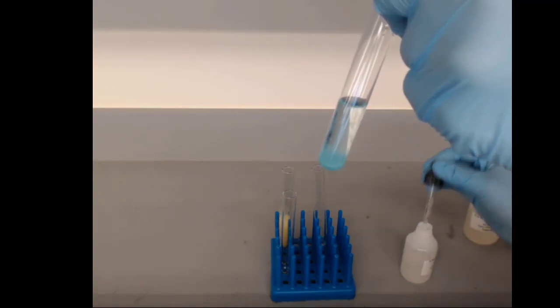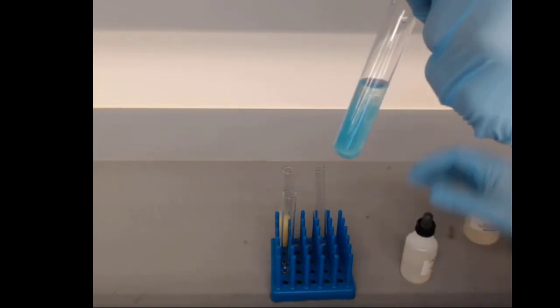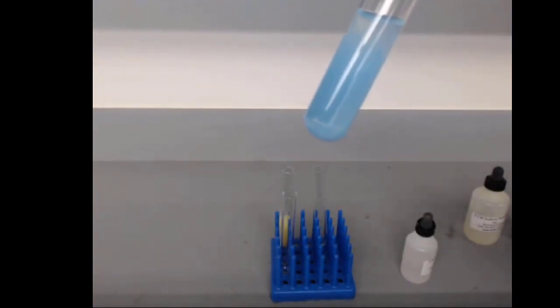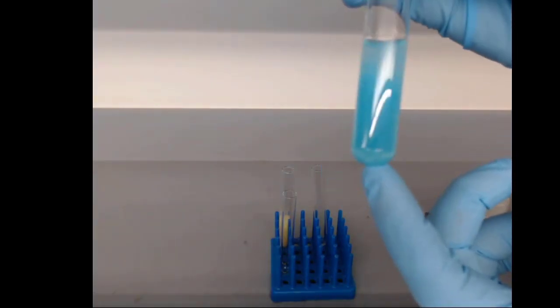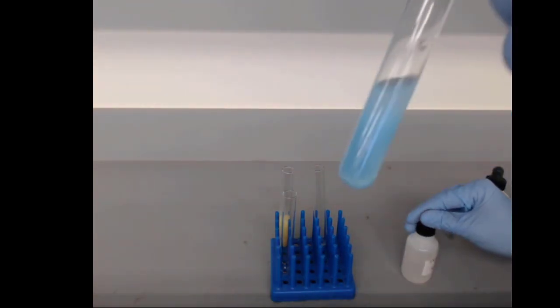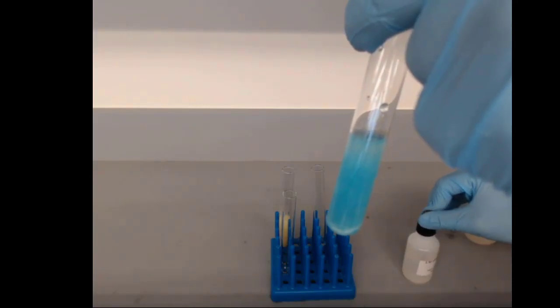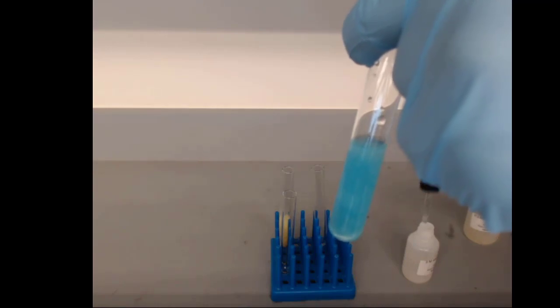And you can see copper carbonate, a nice dense solid being formed. Has that nice kind of flakiness to it, almost has a little shimmer to it that I can see. I don't know if that's going to show up on the camera, but that solid we're forming, that's the copper carbonate. We can see that a solid is really being formed, and at some point I will have added so much carbonate that no more solid forms.